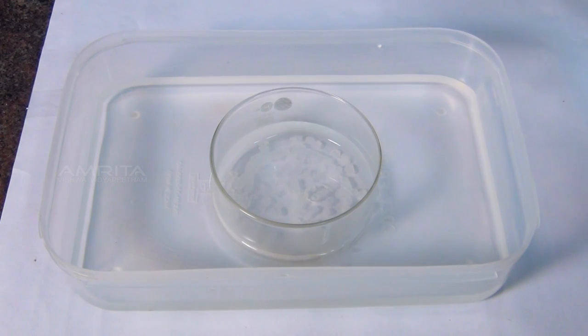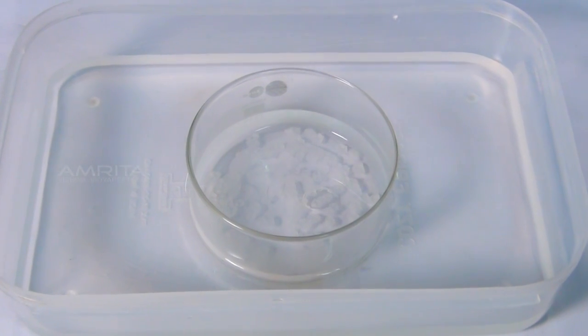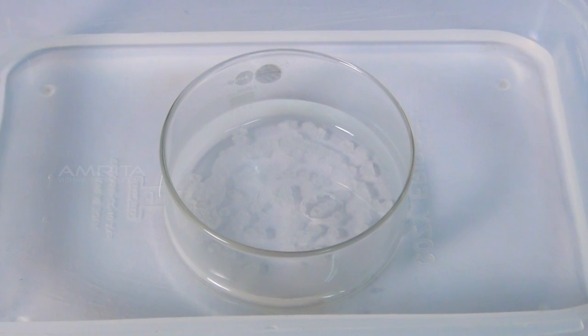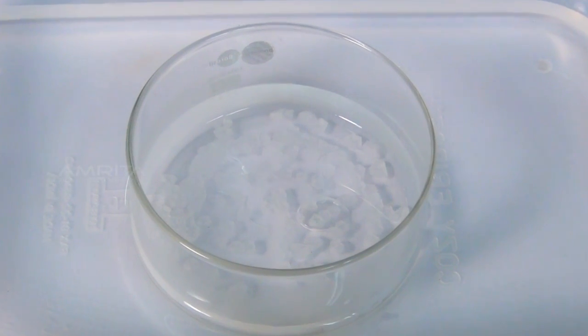As the solution cools, colourless crystals of potash alum begin to separate and the crystallisation will be completed after half an hour.